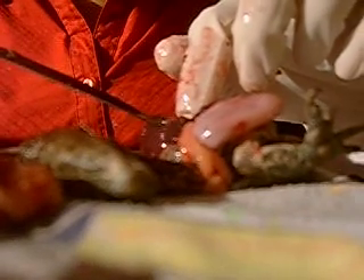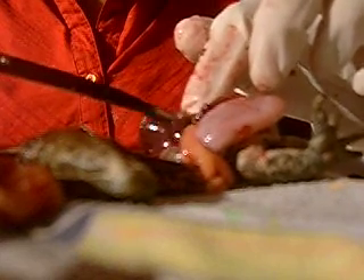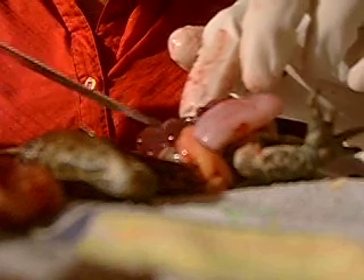She said it has a tumour. A tumour. How do you know it's a tumour? A heart thing — a heart tumour? Lung cancer. I know it's lung cancer because it has a black dot there.